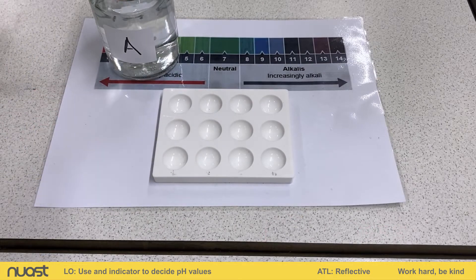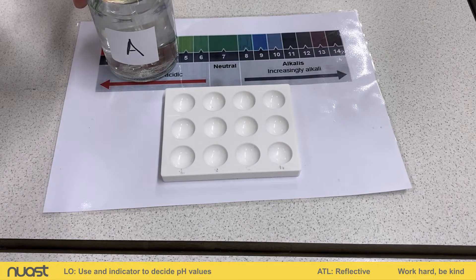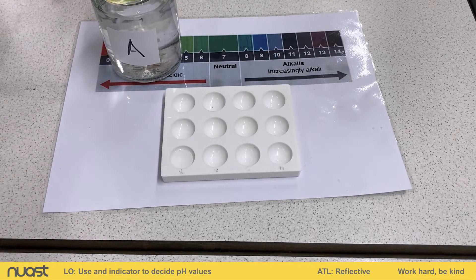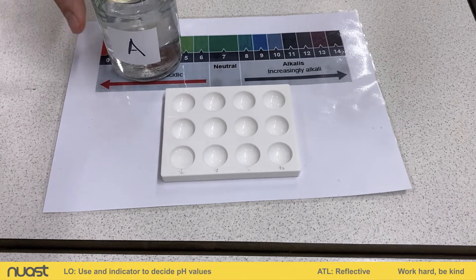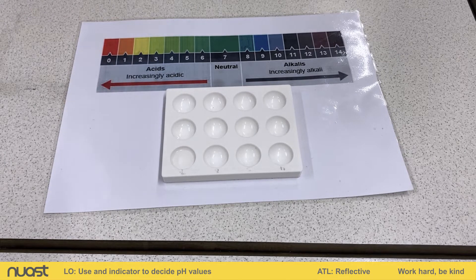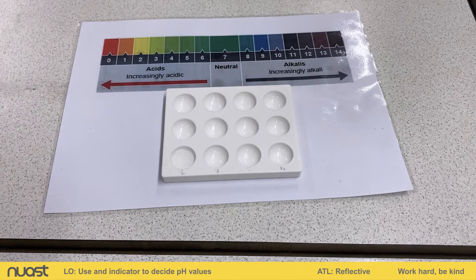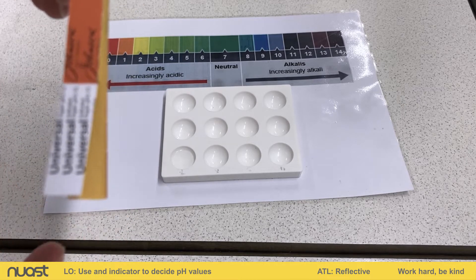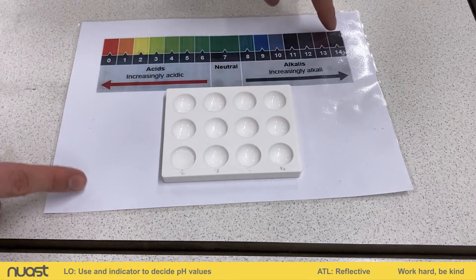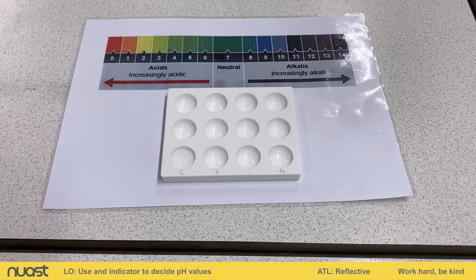So we have solution A. Using the pipette, we're going to place solution A into our first part of the dropping tile. The initial thing we're going to use, reading our method, is universal indicator paper, which looks like this. It comes out yellow, but we'll also have a range of colours shown on the pH scale, which will tell us what type of solution this is.